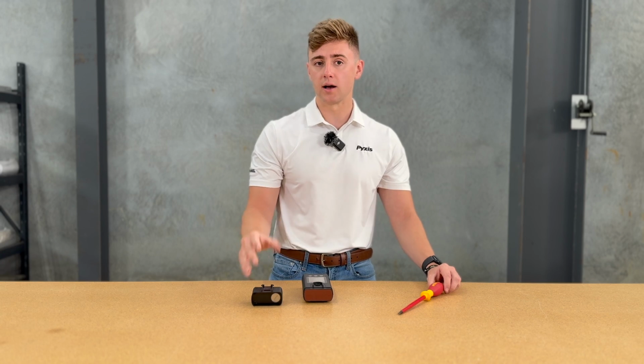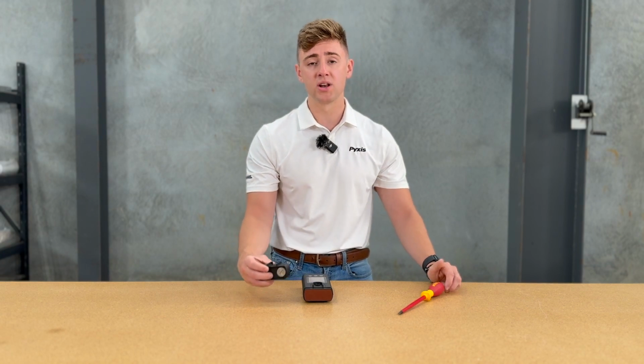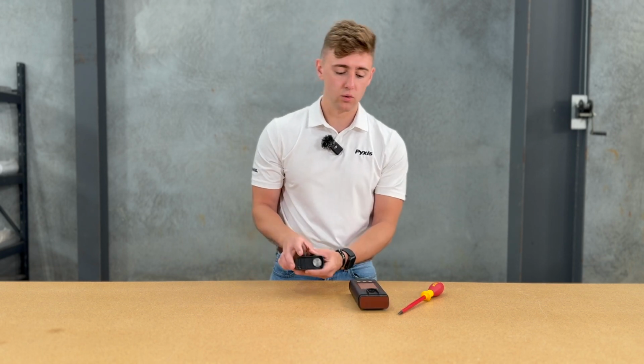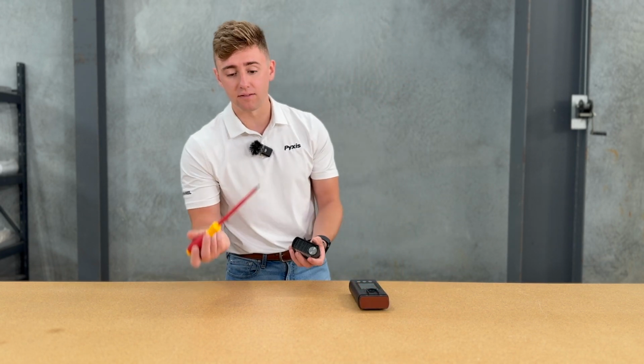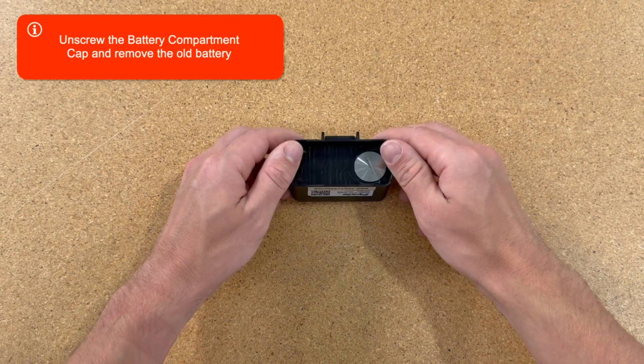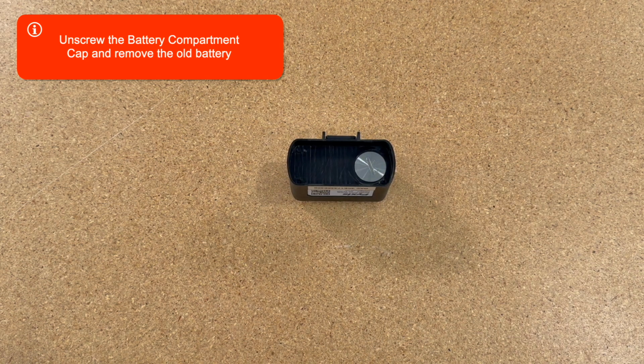If for some reason you're not able to connect to the device, you're not finding it on your device list, another option to check would be the battery compartment at the base of the pH ORP module. If you had it in the field for a little bit of time, the battery could be dead. So one thing that we want to do is take a flathead screwdriver, or if you're in the field and you have a quarter on you or a nickel, that tends to work with this as well. There's a bigger surface area to unthread this battery compartment.